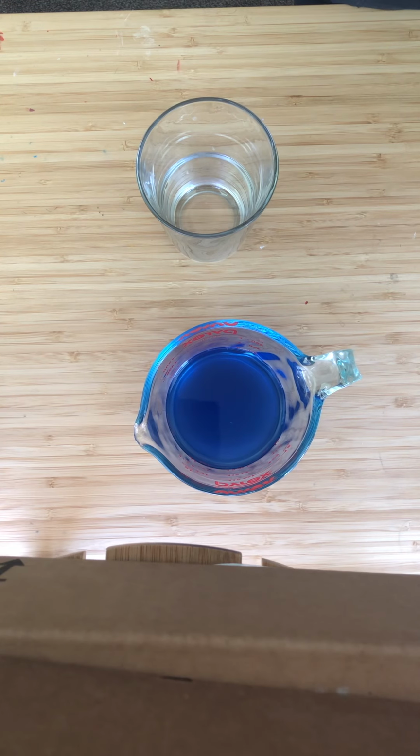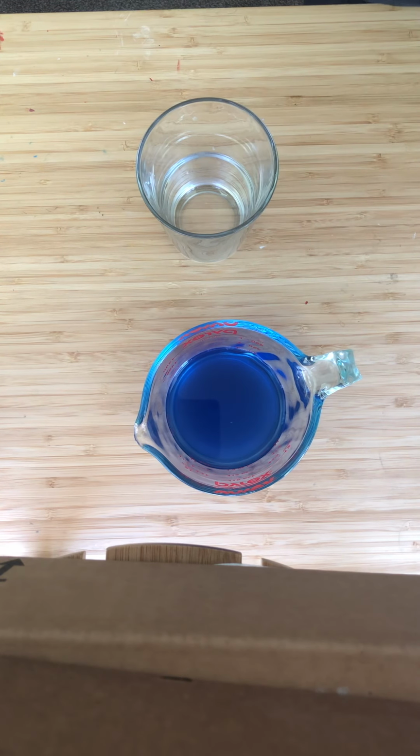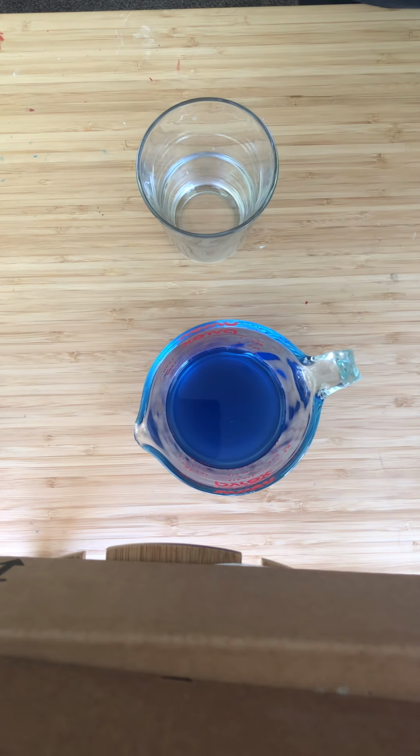So to measure cellular respiration, we use cabbage extract as our indicator. Cabbage extract is a really interesting substance because it changes color when it changes pH. So right now it's this blue color, but if I were to make it more acidic, it would turn more purple or pink in color. And the reason we can use this to measure cellular respiration is because CO2 is a byproduct of the reaction. So if I added CO2 to this cabbage extract, it'll lower the pH of the cabbage extract and make it change color.